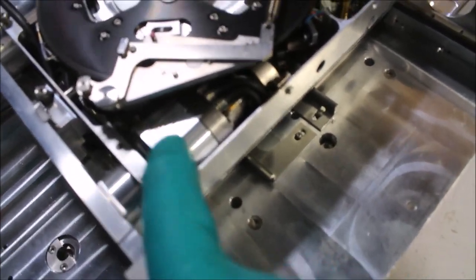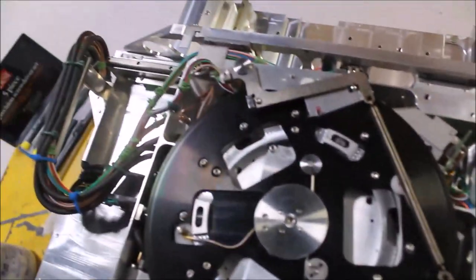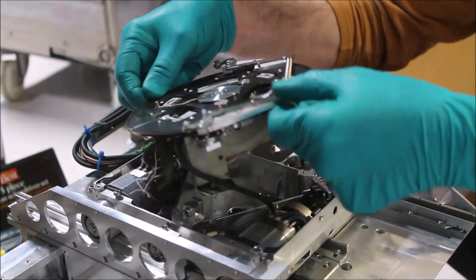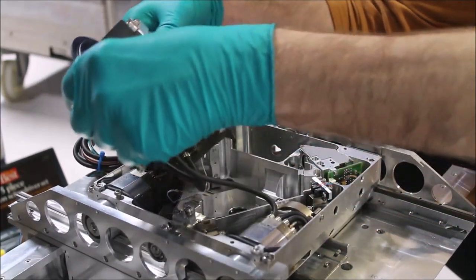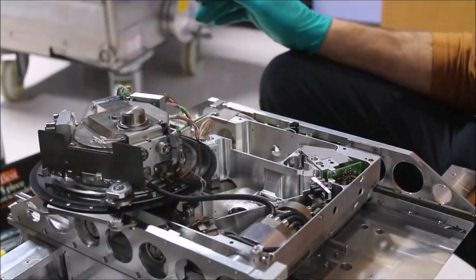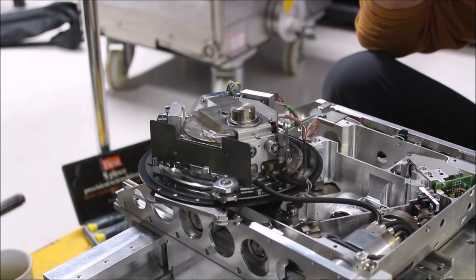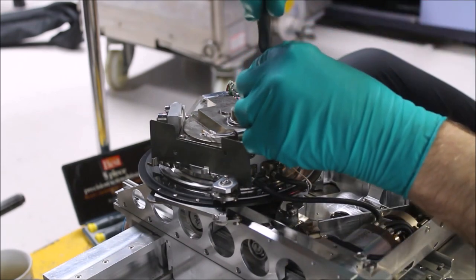This is a Y motor. This is also a Y motor. The X motors are hidden underneath here. These black lines are brake lines and vent lines for the motors, or ventilation lines for the motors for cooling.